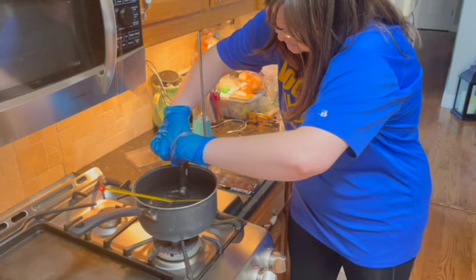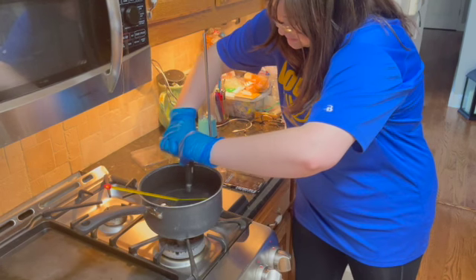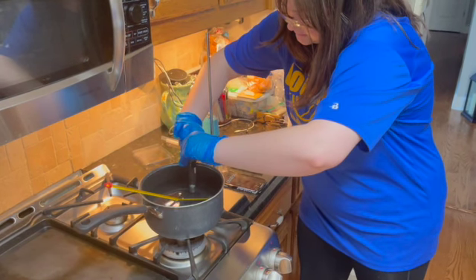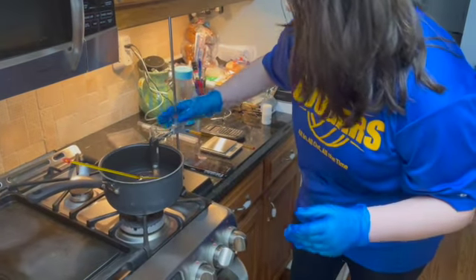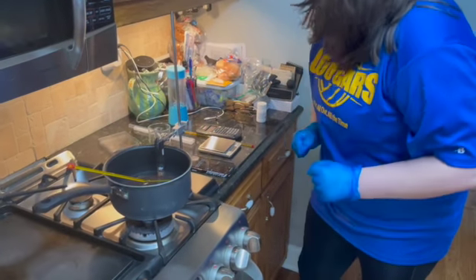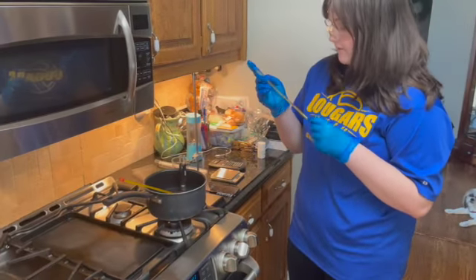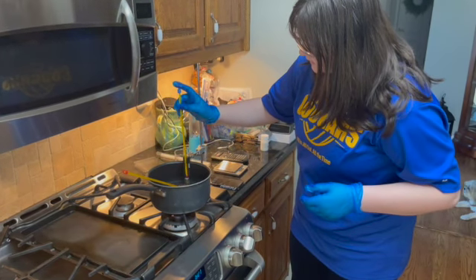Okay, so tighten. Okay. As you can see, the paradichlorobenzene is all the way in, and I'm starting the timer. And let me then also suspend my thermometer into here as well, and make sure that I'm not touching the edges as much as possible.